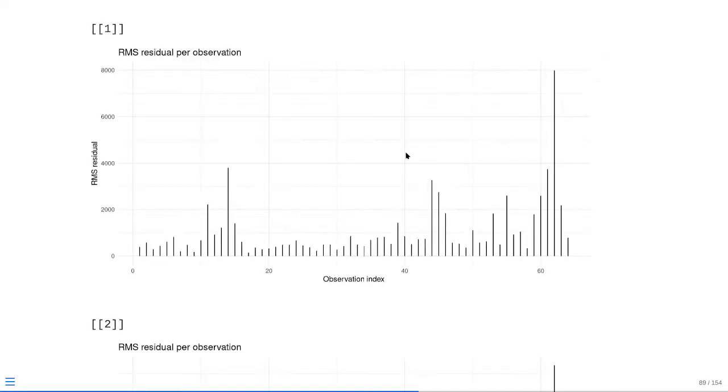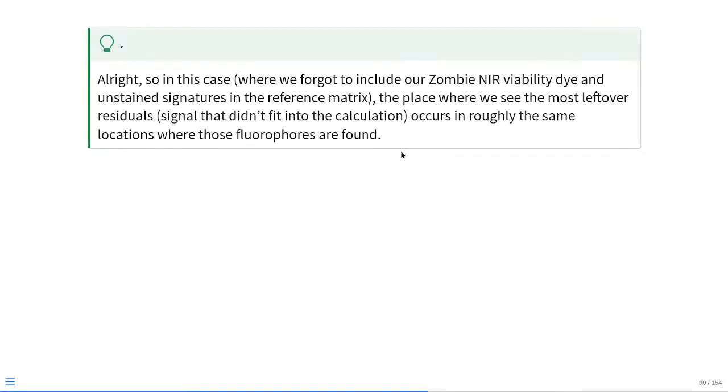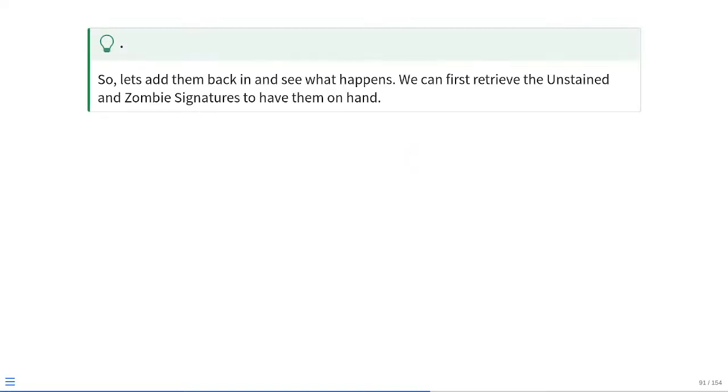So if we go ahead and run it, you can see we're getting back a residual style plot running from 0 to 64, which corresponds to the number of detectors that we had. And in this particular case, you may remember we forgot to include Zombie NIR, so our residuals are kind of high towards the last few detectors, which would correspond to where we expect to see the peak fluorescent emission for the Zombie NIR fluorophore. So that's pretty cool to see, and it's one of those reasons why looking at the residuals can be interesting. So let's take a closer look at that in the next couple examples.